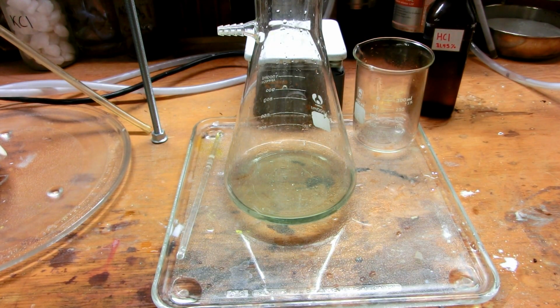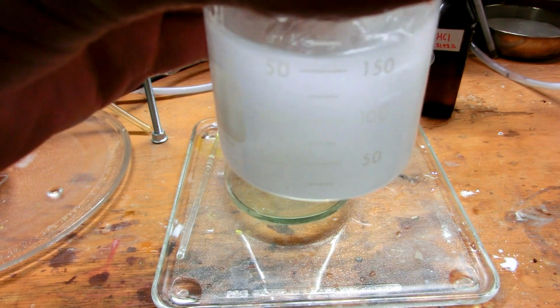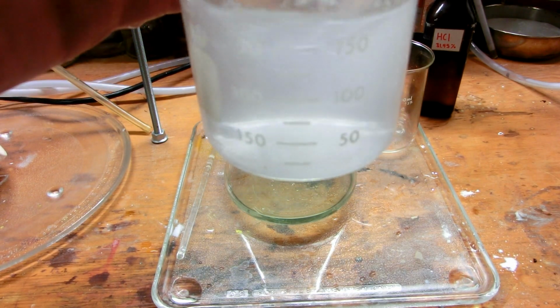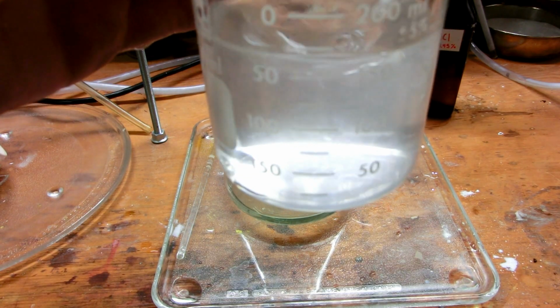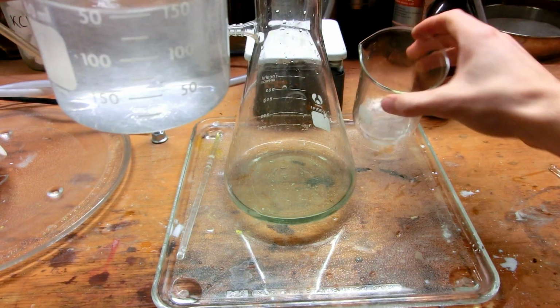Now, of course, if you were doing this analytically, you wouldn't use tap water, but we're just making something that we're basically going to burn, so I'm not using distilled water or anything. Anyway, so here's the water added to the oxalic acid, which I'm going to stir. And we better make sure the oxalic acid is completely dissolved. Now, iron oxalate has almost no appreciable solubility in water, so it should precipitate as a bright yellow precipitate when we add our ferrous chloride.